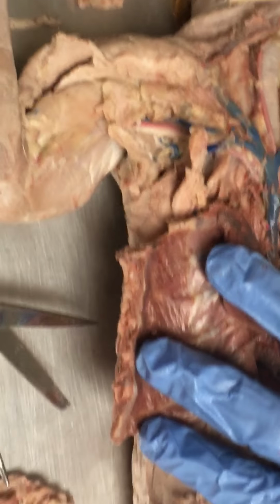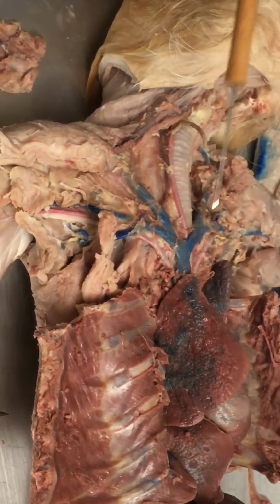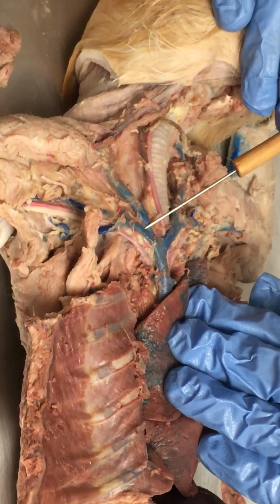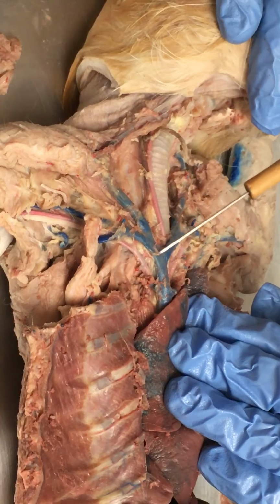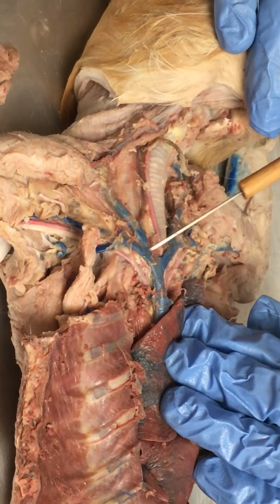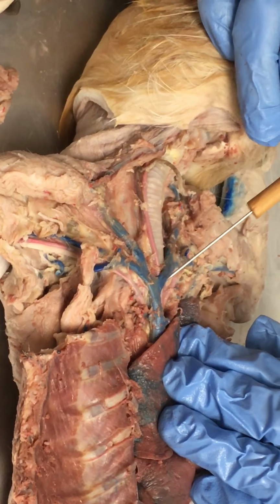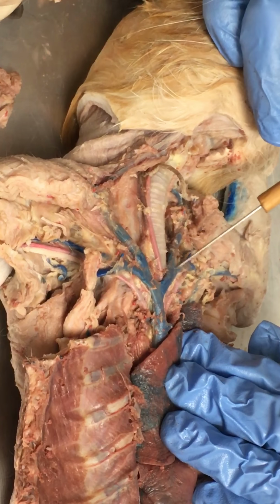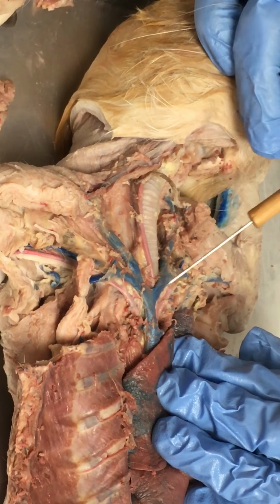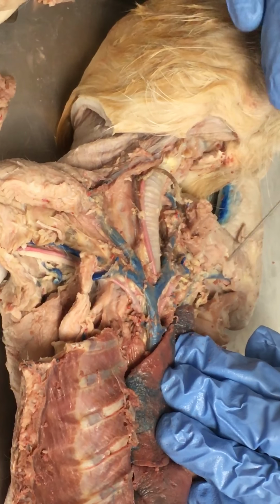Let's see. So from there we'll just go into the major blood vessels up here. I'll kind of do right and left at the same time. So at our branch point, to our next branch point, we have the brachiocephalic vein. It's literally only this long from one branch point to the next. This is the right brachiocephalic because we're on the right side. Here to that branch point would be the left brachiocephalic. So right and left brachiocephalic. It's brachiocephalic because brachio is arm, cephalic for head.